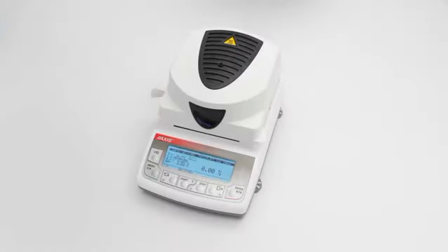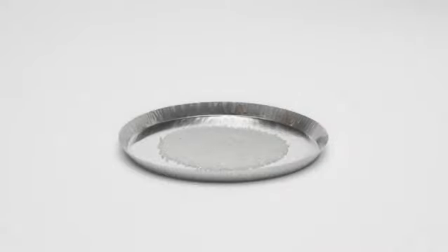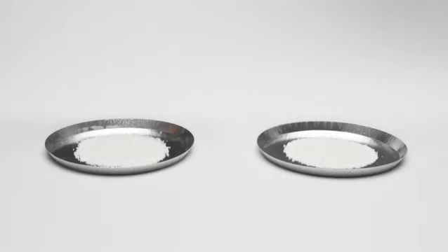Proper sample preparation is necessary to obtain accurate and repeatable measurements. There are a few things to keep in mind. 1. Distribute the sample evenly on the surface of the pan. 2. The thinner the sample material layer, the better the drying process. 3. If you make several measurements for the same type of material, each subsequent sample should have a similar mass.